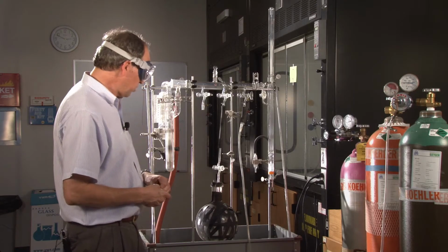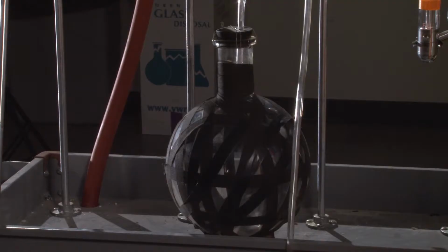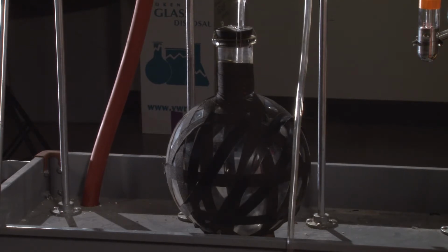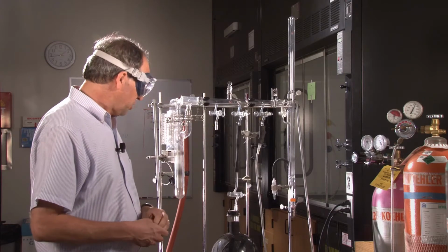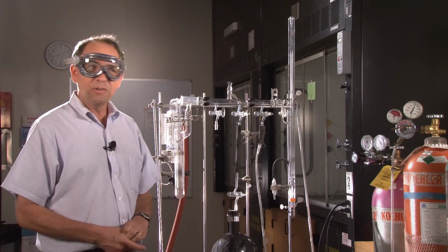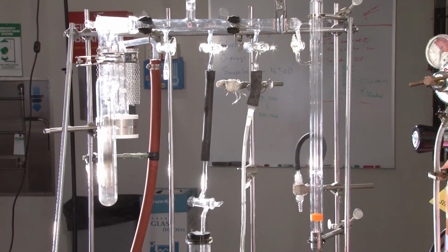In order to do that, we're going to be using this as the vessel. This is a 5-liter gas flask, and it's all wrapped up with tape like that for safety purposes. In order to do this, we're going to be using this apparatus. It looks rather elaborate, but it's not actually all that complicated.